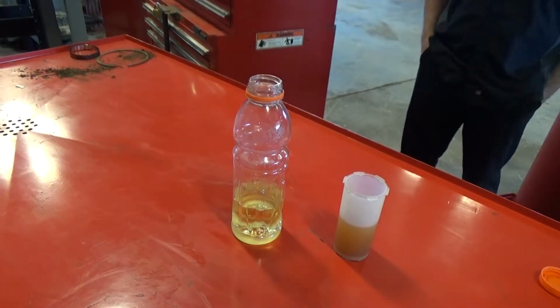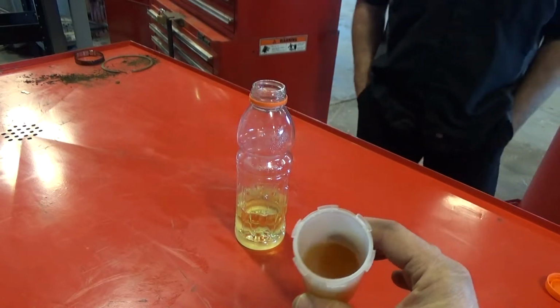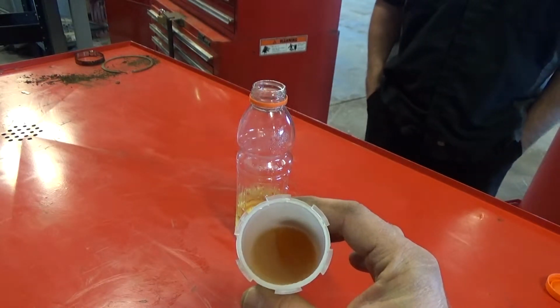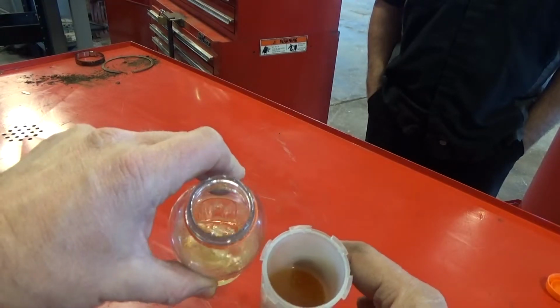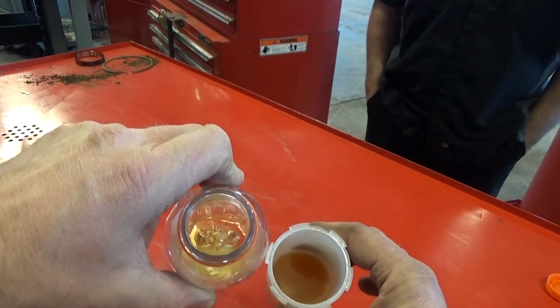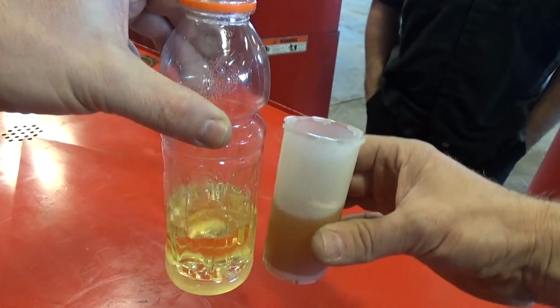There we go. All right, so you guys are looking at the fuel. This is really pretty poor quality fuel. You can tell the color difference between the two of these. And we're doing a makeup lab right here today, but I wanted to do this so in the future, if you guys miss this lab, you can see the color difference between the two fuels.